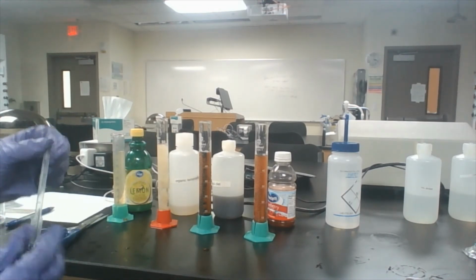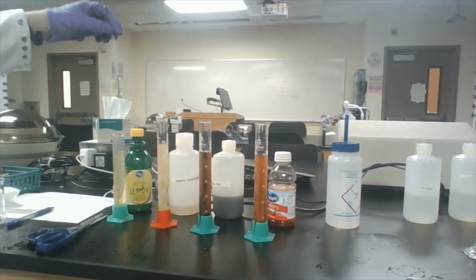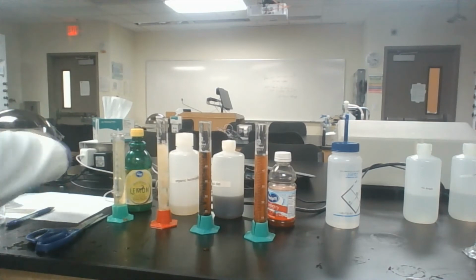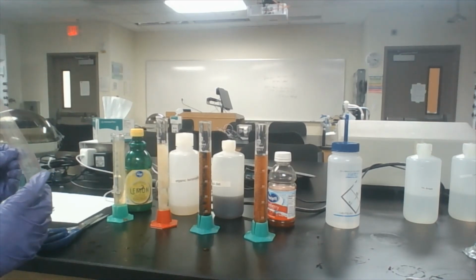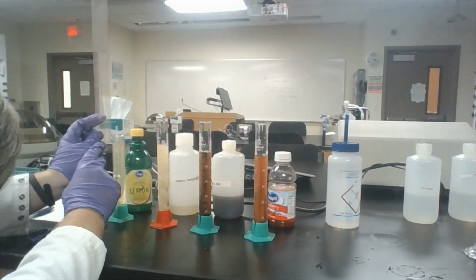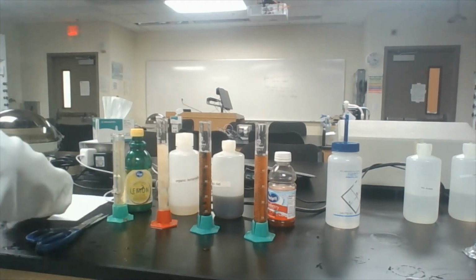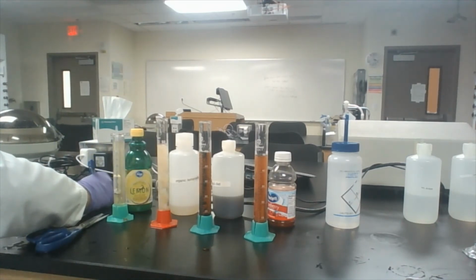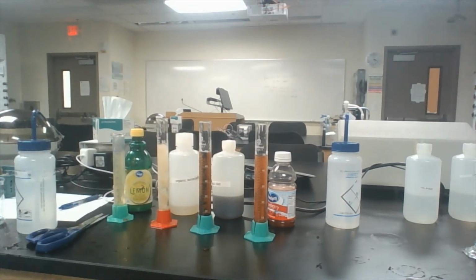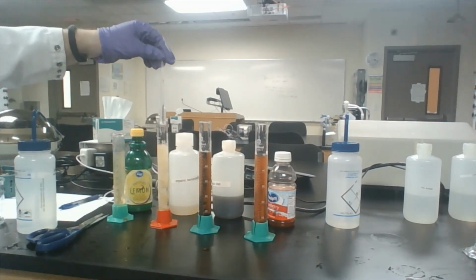And so we're going to take our hydrometer from before, which I have cleaned and blotted, and we're going to put it into our lemon juice first, and then we'll measure the distance between the top of the liquid and the top of the pipette. And that is 32 millimeters. Okay, so we remove it, rinse it, blot it, and then use it again. Like I said, we're using this same one because that way what we're putting in is consistent. The only thing that's different is what the juice is that we're inserting our hydrometer into.